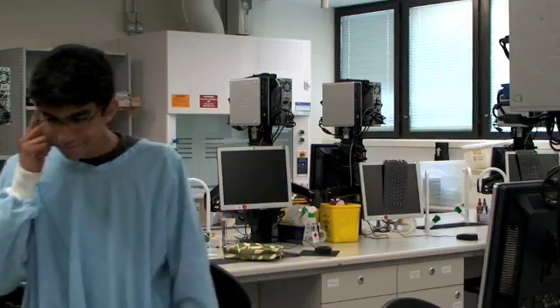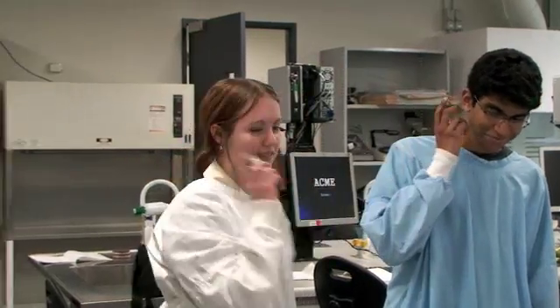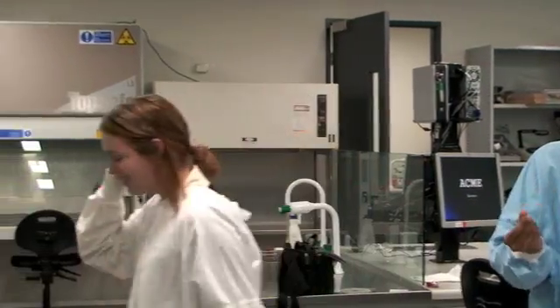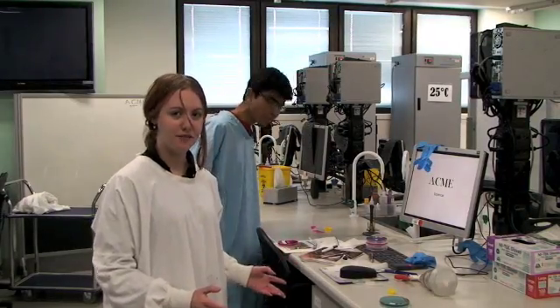Hello? If you answer or use your mobile phone in the lab, you'll spread contaminants, so your phone may be confiscated and you'll never see it again. Hello? Oh, hey, Leroy, I haven't spoken to you today. Look at this. This is a terrible working environment.